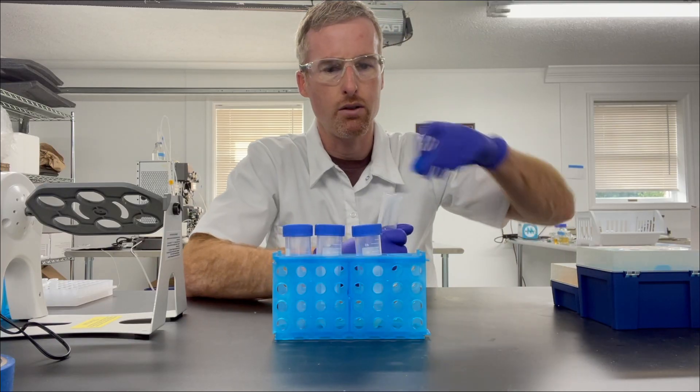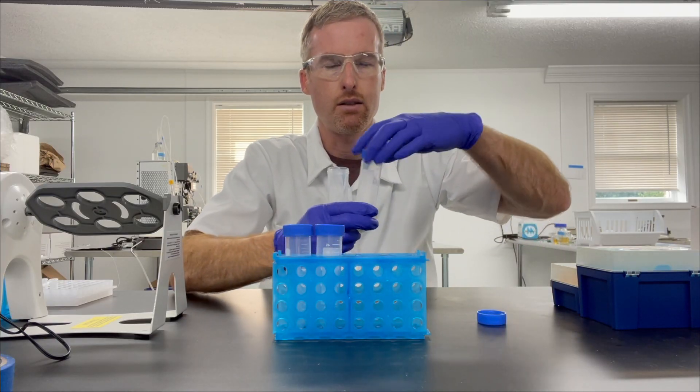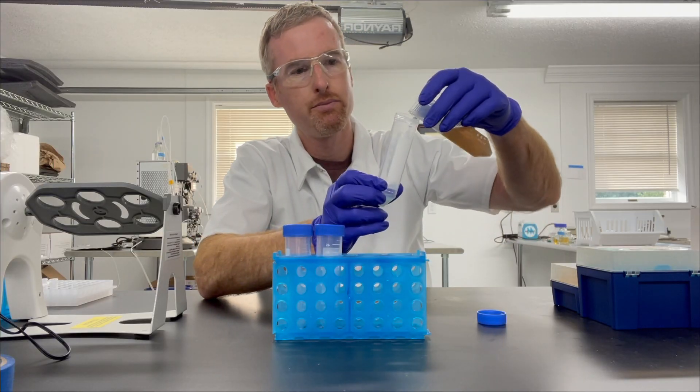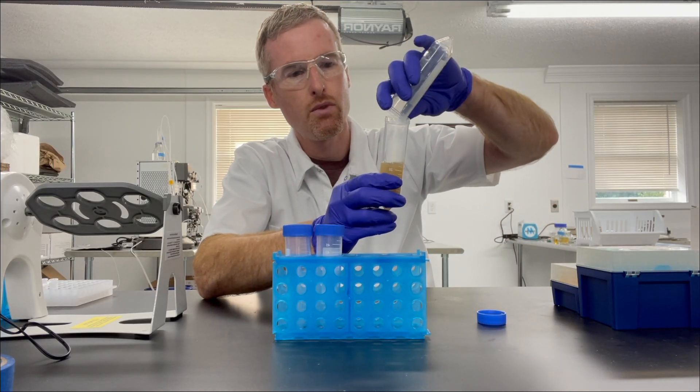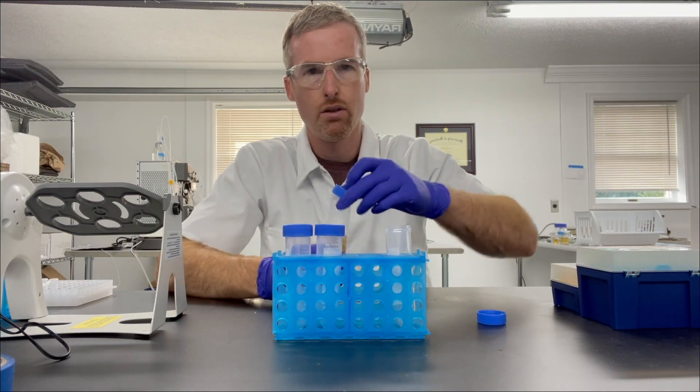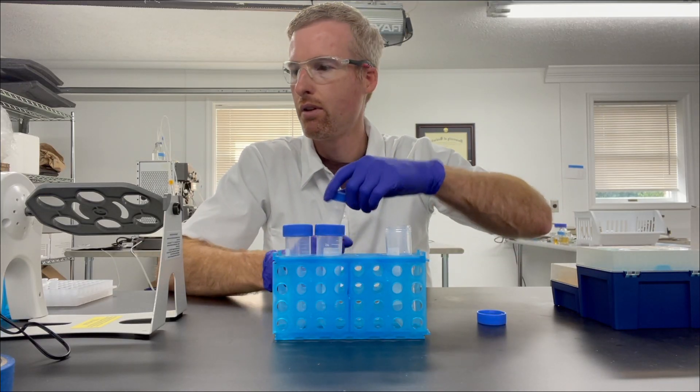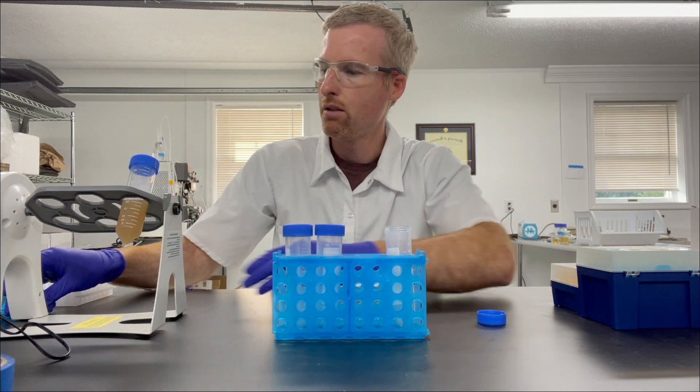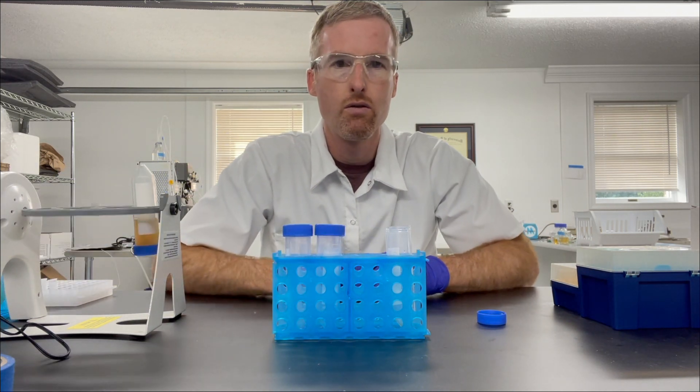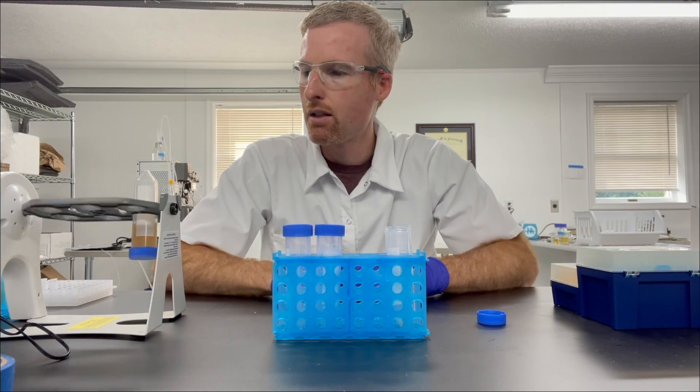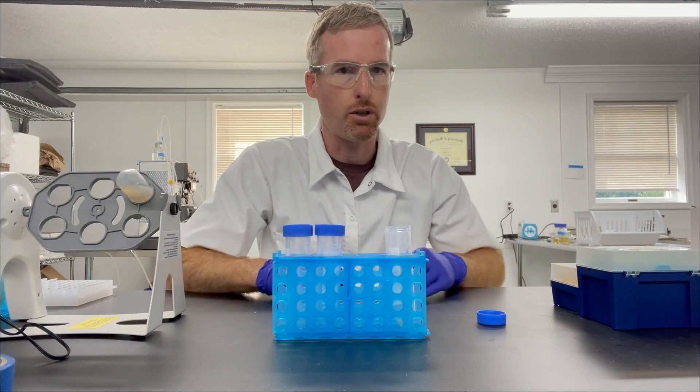So I'll go ahead and add the lysate to the nickel agarose, cap it, and then it's going to mix end over end for 15 minutes, and when it's done, I'll see you back here for the purification part.